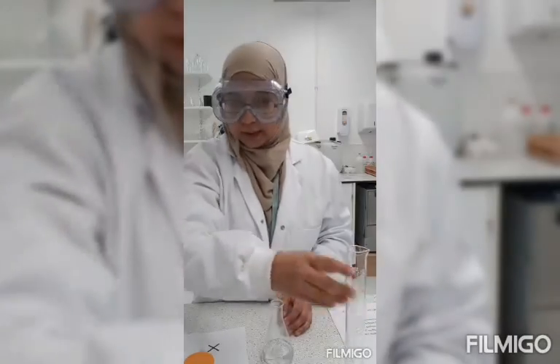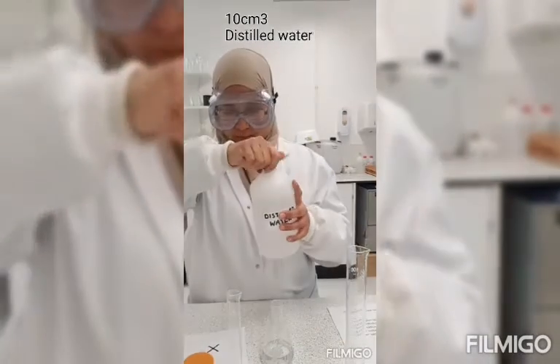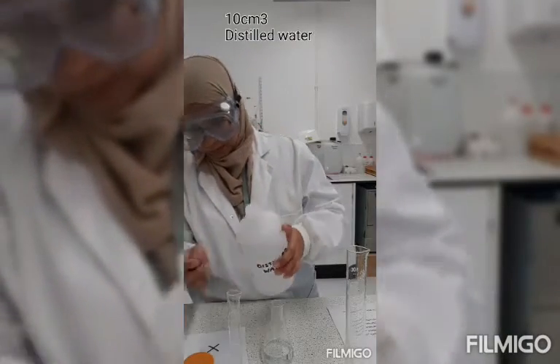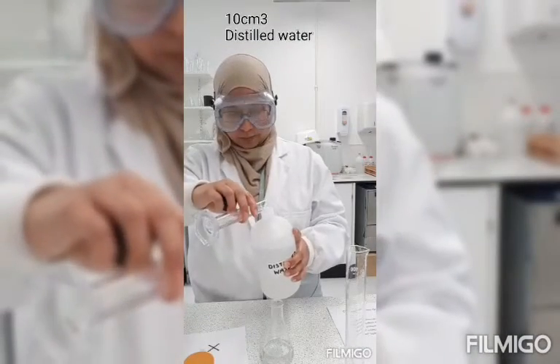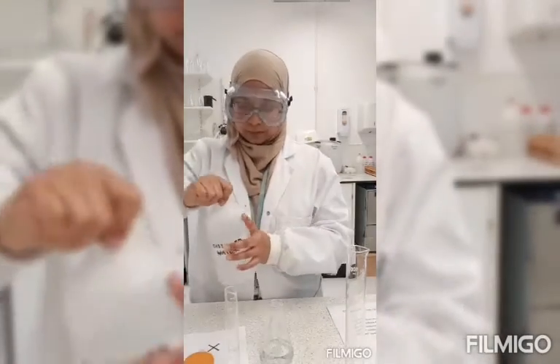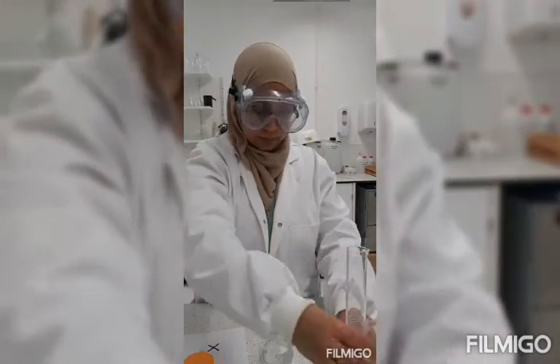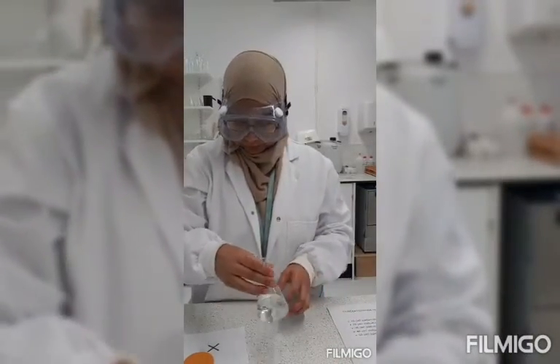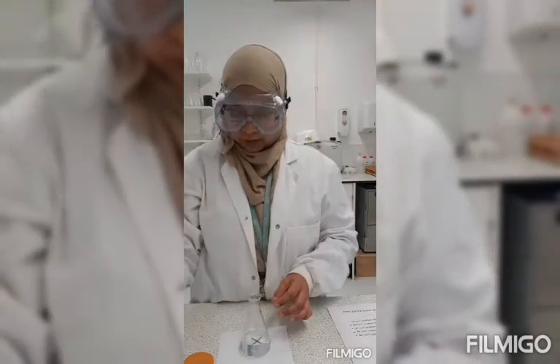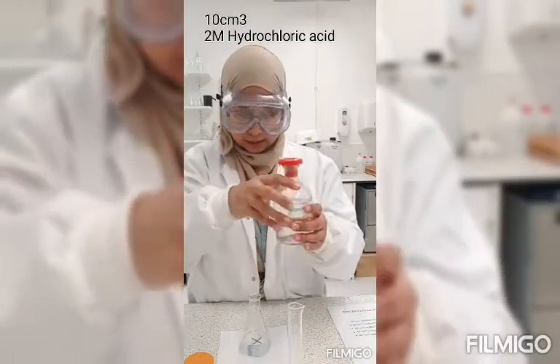Then I will measure 10 centimeter cubes of distilled water. Pour that into my flask. Give it a swirl. Put my flask on top of my cross. And then I will measure 10 centimeter cubes of 2 molar hydrochloric acid.